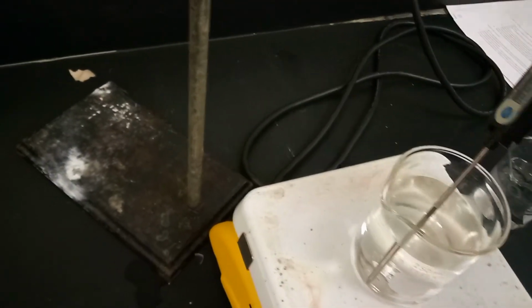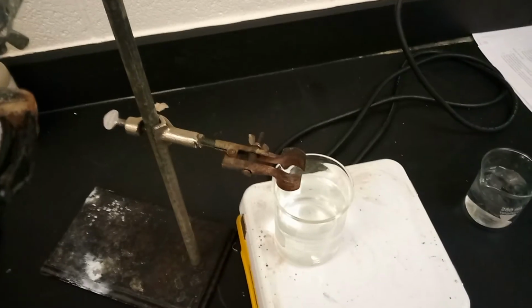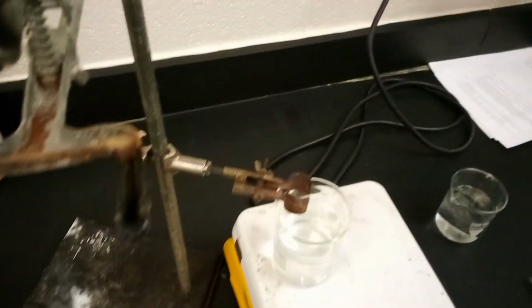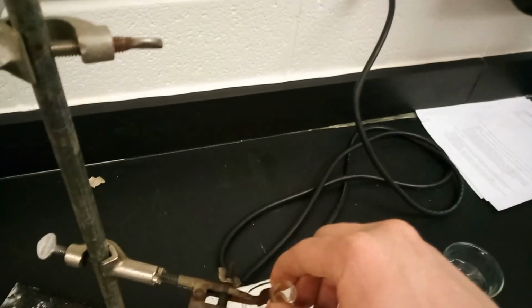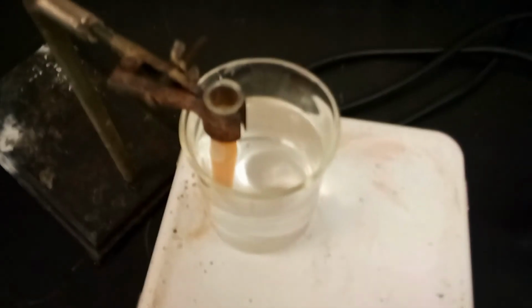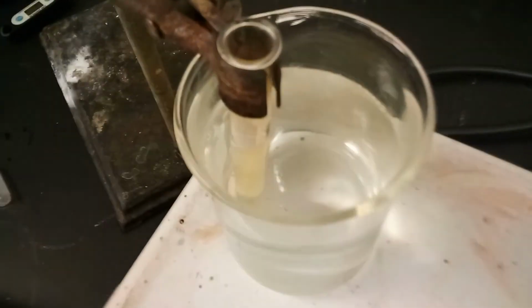And then just like we did with a cold water bath, we want to do with a hot water bath. 70 degrees is what you want there. Mine was reading 71.2-ish. But you want to put the test tube into a test tube holder so you don't have to hold the test tube over the hot water for those 3 to 5 minutes. So like so. And now we wait again.